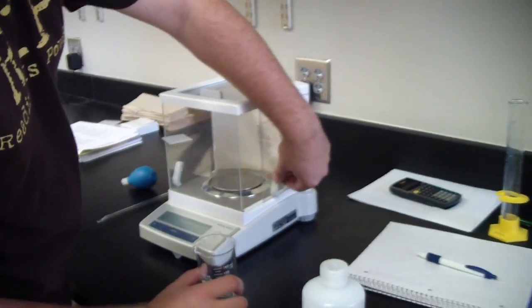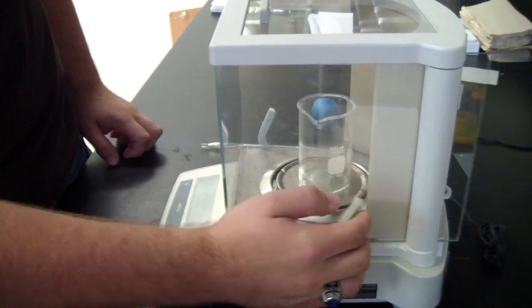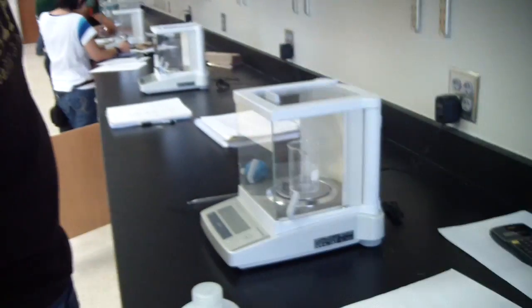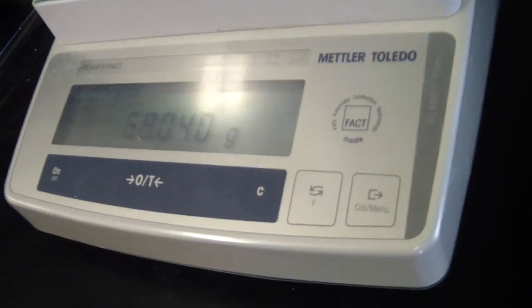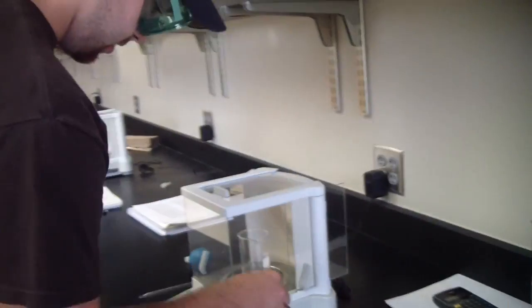So to weigh this 150 milliliter beaker by itself, you gently open up the window, place it inside, close it, and wait for it to stabilize. As you can see, the mass is 68.040 grams. So that's just the weight of the beaker.